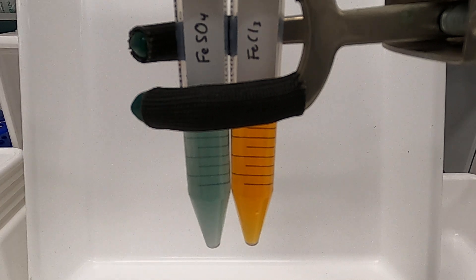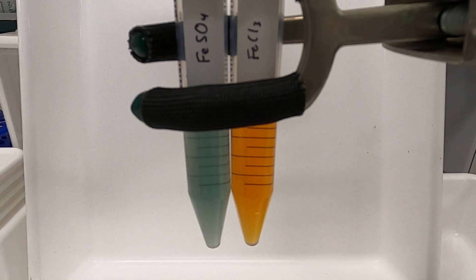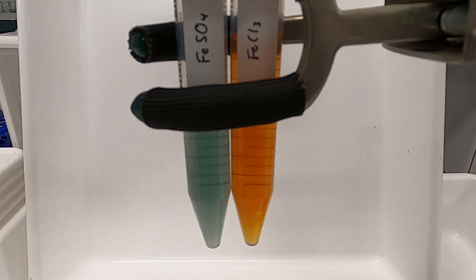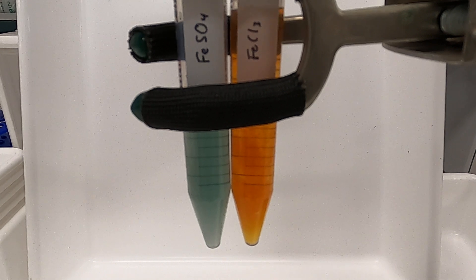So the process on the ferric chloride is a bit slower, so I'm going to add a little more base to that reaction. So some extra hydroxide or OH minus.